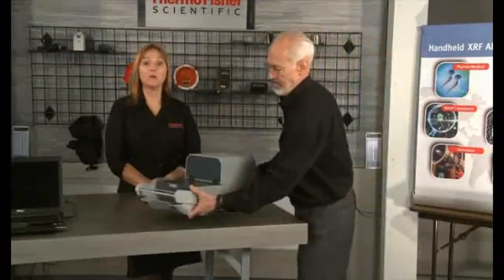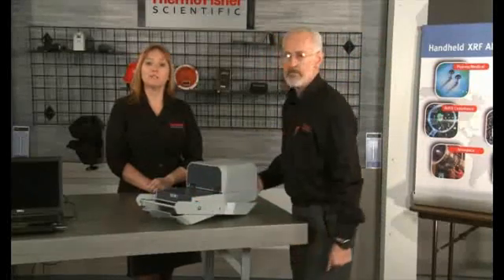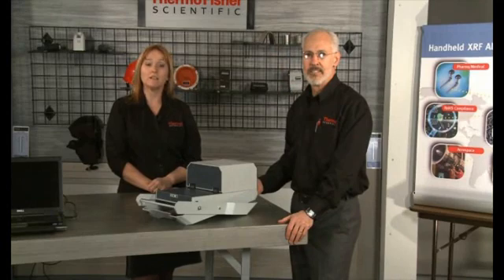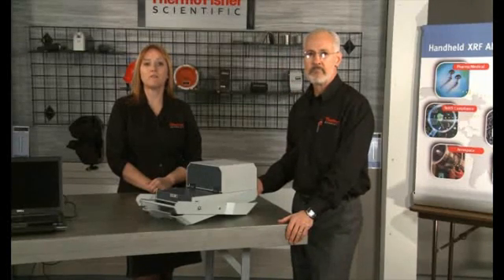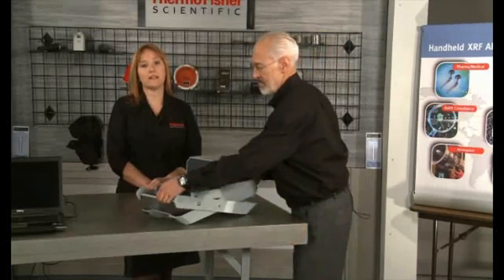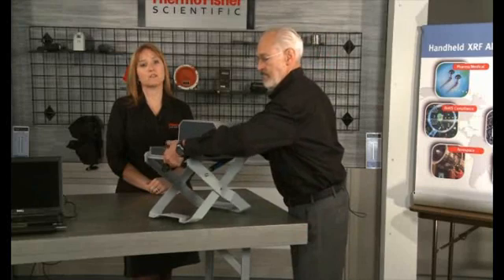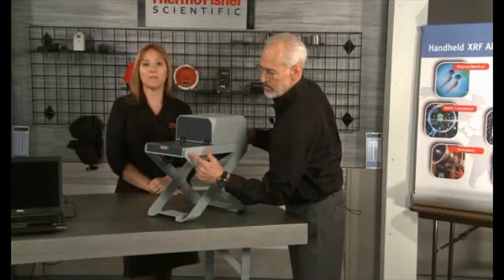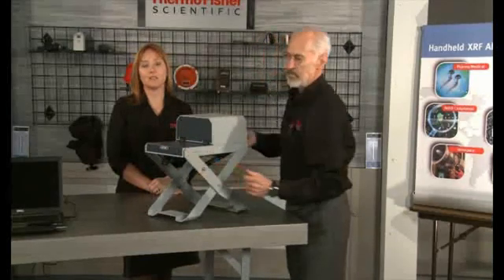A useful accessory for benchtop testing of small parts is the XL3T Smart Stand, portable test stand. We will utilize this stand for safety with undersized samples in our following demonstration. To set up the stand, place the folded stand on your benchtop with the scissored legs down. Next, lift up the top part of the test stand. As you do so, the scissored legs will rise up and come together. Hook the bar in the notch in the back of the test stand.